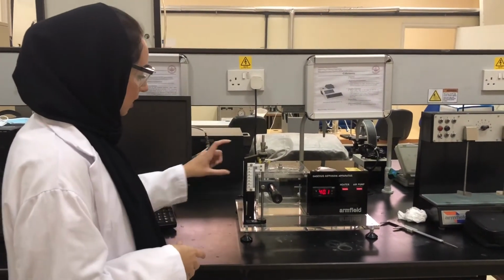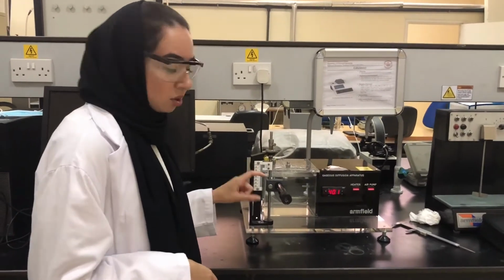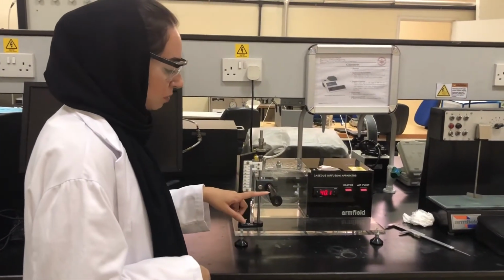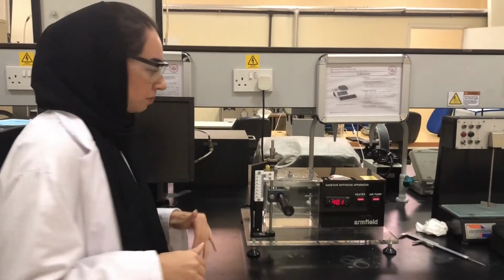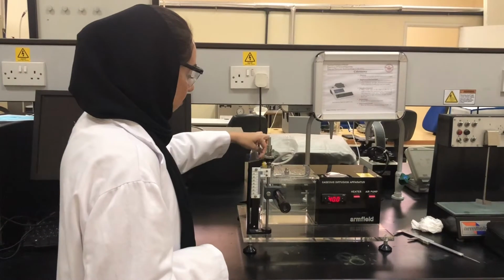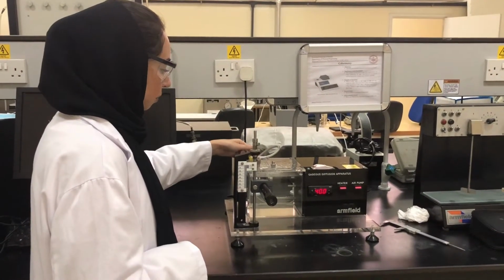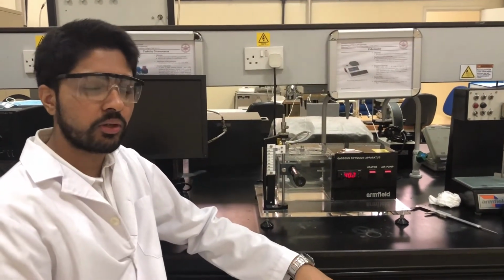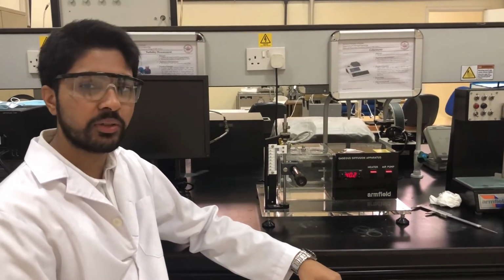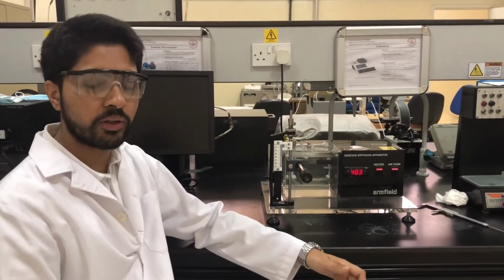In this apparatus, this is the vernier caliper, which we'll use to calculate the change in the length, which we'll see with the help of this microscope. Through this microscope we'll see an inverted meniscus. We're using this air pump for a continuous flow of air so that the concentration of the acetone at this point remains zero. To measure the change in length of the meniscus, we've decided to use a 15-minute interval, at which point we will get readings and plot the graph.